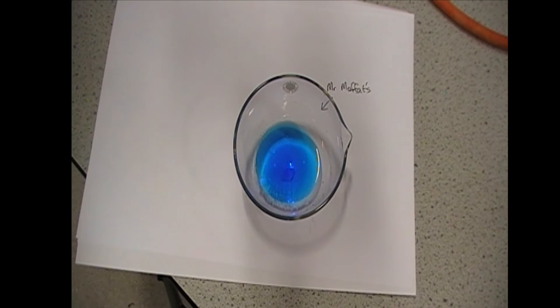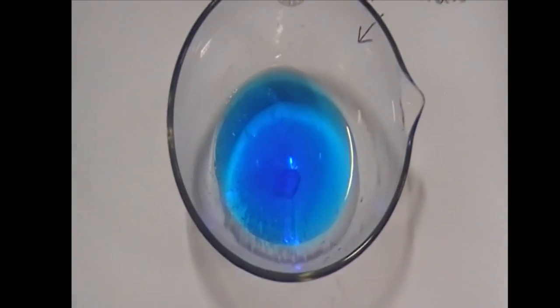So this is our crystal. It's been on the windowsill for a few hours and we've actually got quite a nice sort of single crystal growing in the middle. A few of the little small ones. But just to show you that if you put your name on a bit of paper and put the crystal on top of it, leave it on the windowsill, you'll be surprised just what sort of results you can get even the same day. We'll come back to this in sort of 24 hours and see what we've got. Let's just have a little zoom in if you can see that crystal.